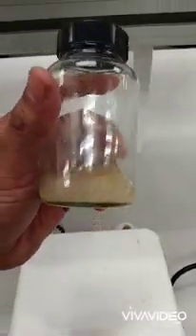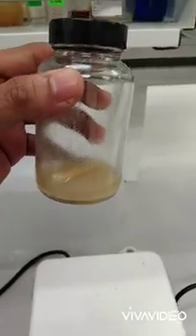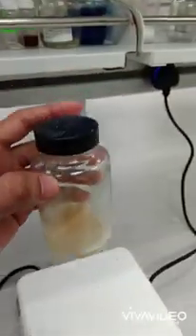This is my polymer after about 3 hours of synthesizing. You can see it's completely homogenous now, ready for spin-coating.